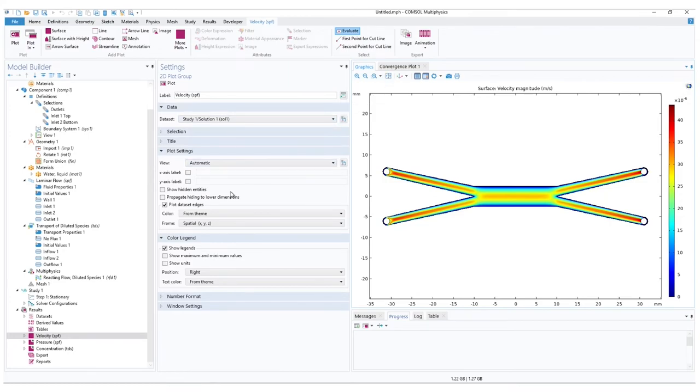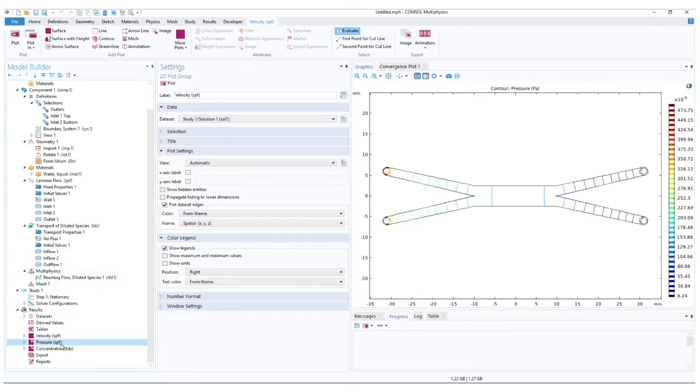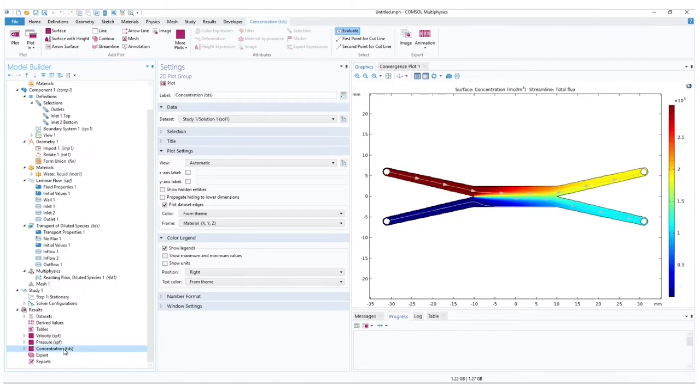Next we have the pressure view in Pascals. Here we can see the colored lines with specific pressure values. And lastly we have the concentration graph. Here we can clearly see how the mixing occurs. We have our higher 3 moles per liter concentration at the top and lower 0.001 moles per liter at the bottom inlet. At the outlets, we can see that the mixing has not been very equal.